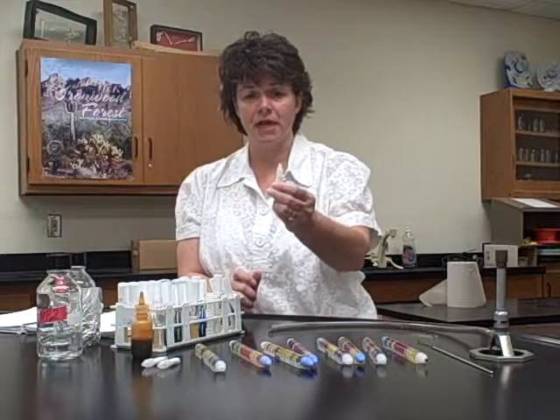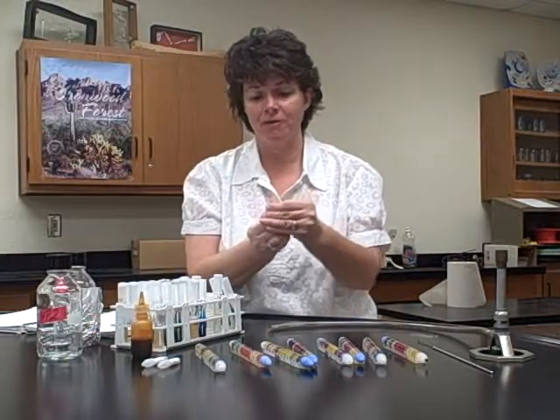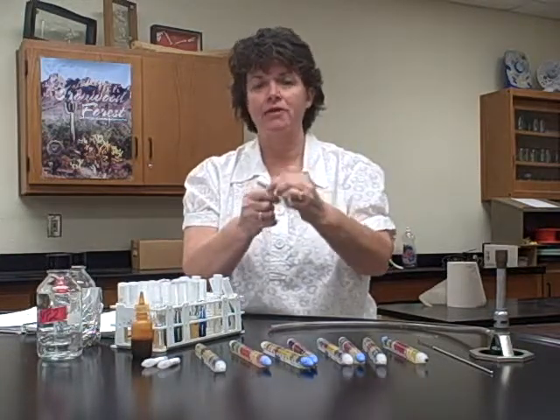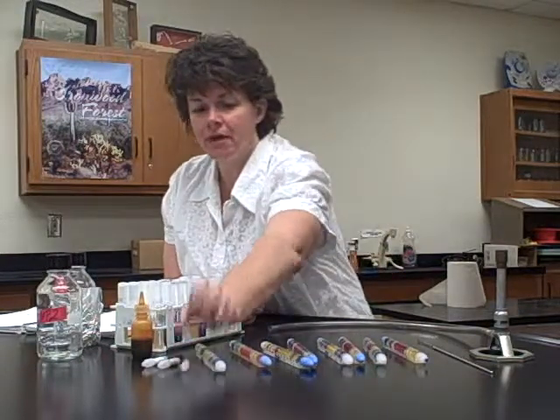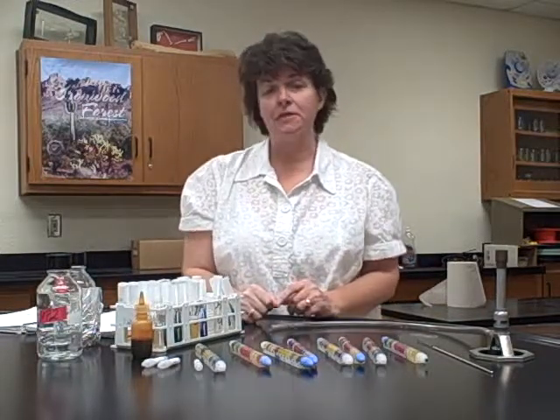This is one of those glass ampules like we did for the flagella stain. So what you do is you break it, and then you turn it upside down and squeeze it. You don't take the top off, because remember, inside is the glass ampule, and if you take the top off after you break it, you'd end up with glass in there. Okay, so you'll add the amount of drops that you need to the tube that said tryptone on it. Okay, so that's for the indole test.